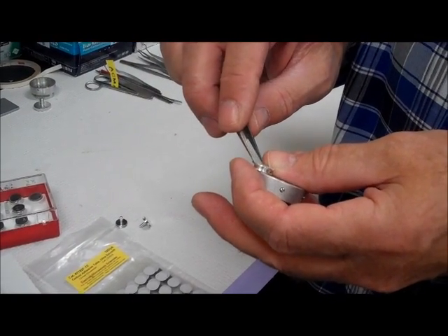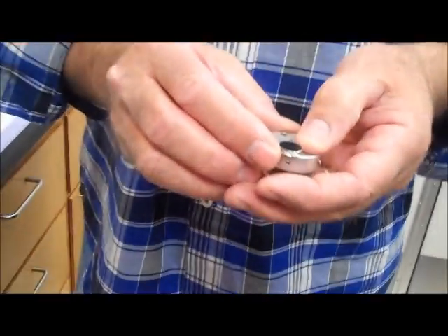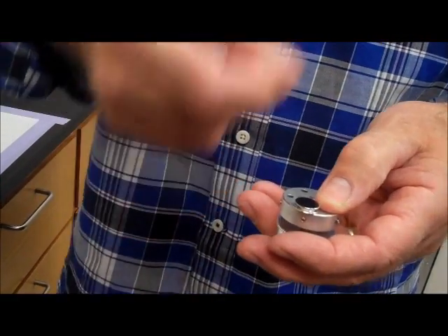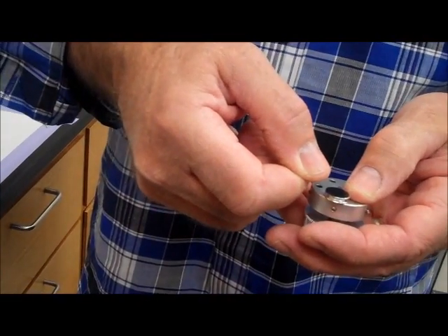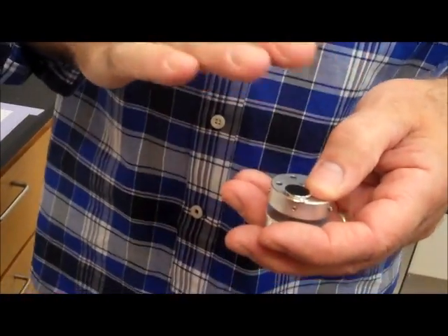These tweezers are shot, they've been dropped a few too many times. So this is a double stick adhesive, so we take the quarter and then we just lay it down on top of it, and then just kind of push it in a few places so it makes contact.